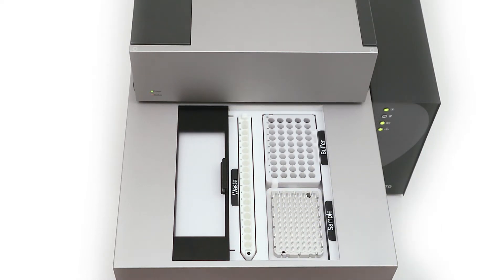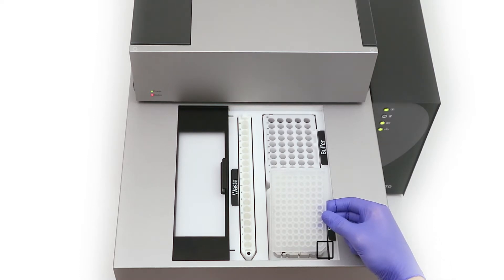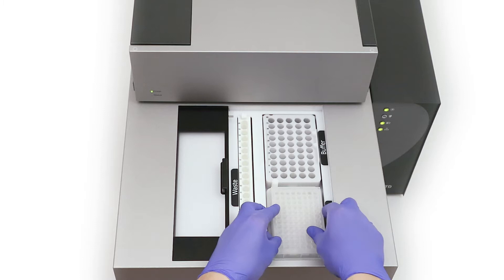Your well plate can now be inserted into the autosampler. The cut corner of the microplate must be aligned bottom right with well A1 bottom left.